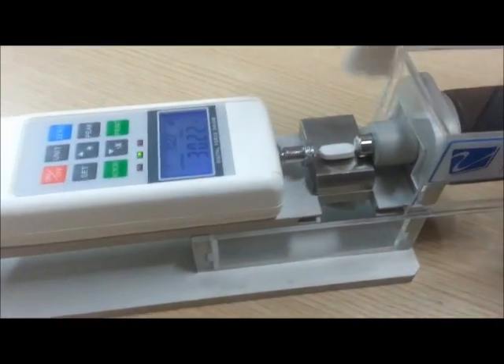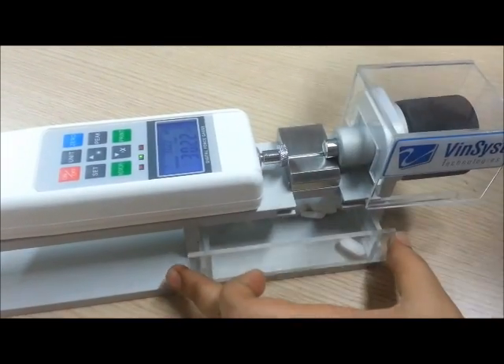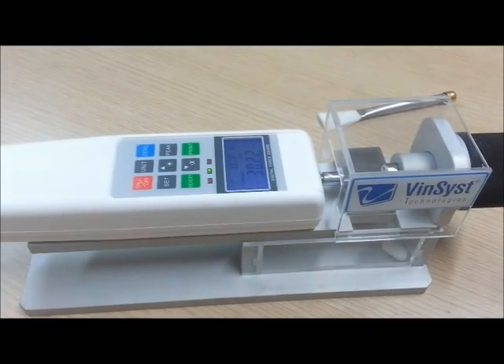You may clear the debris in the box given below, and the instrument is ready for another test. Thank you.